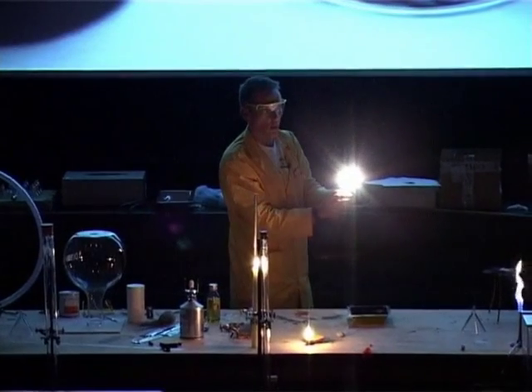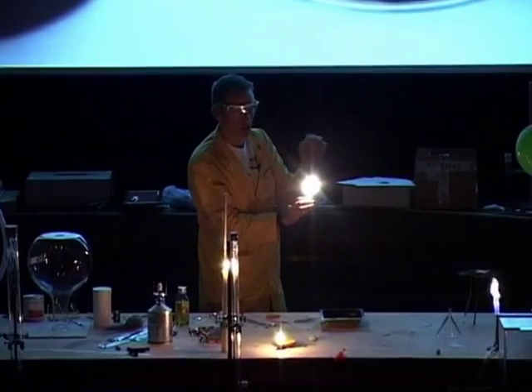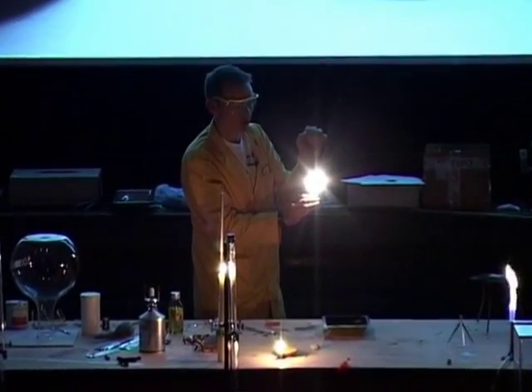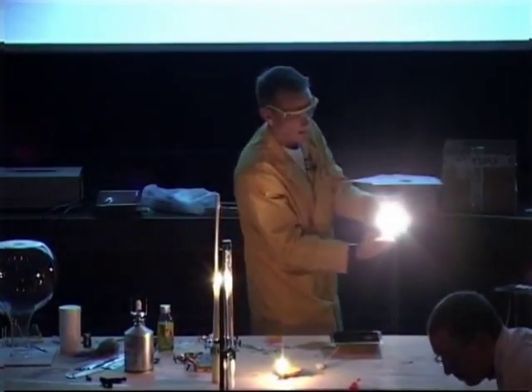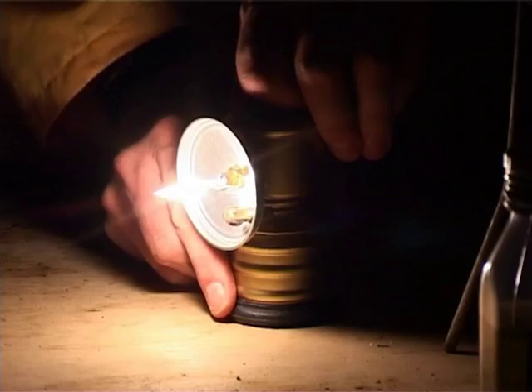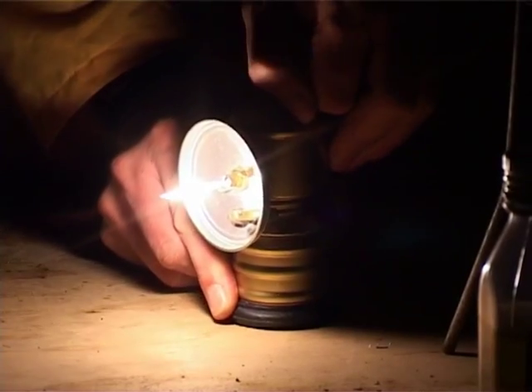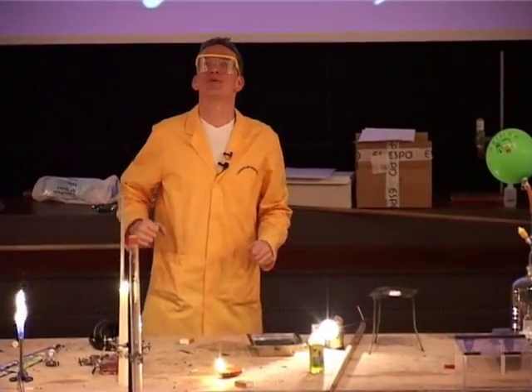We get a very white-coloured flame there. We've still got particles of soot, and they're still being heated up by the energy given out by the reaction. The soot is still coming down — we're still getting black snow coming down from the ceiling.